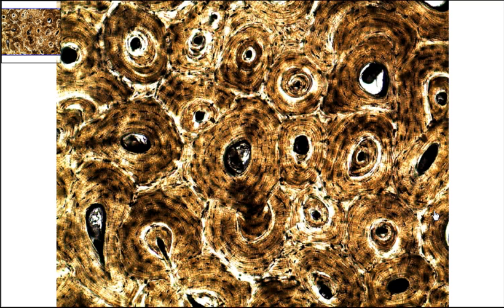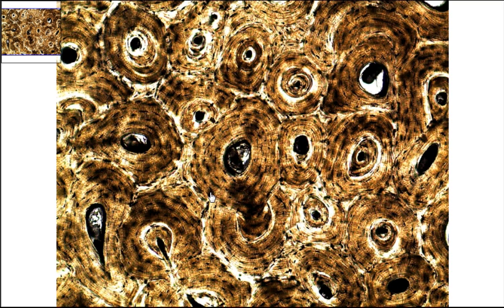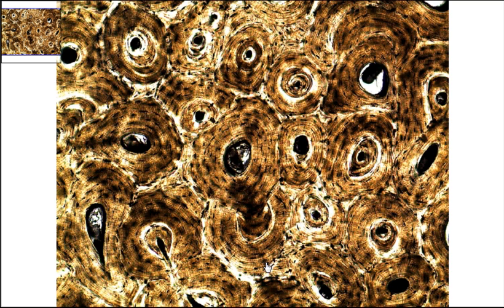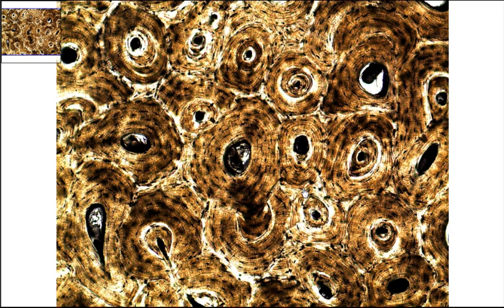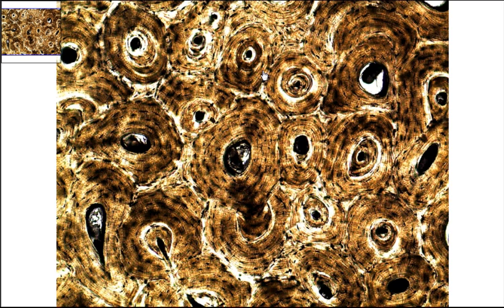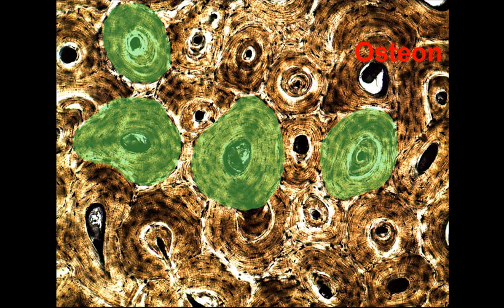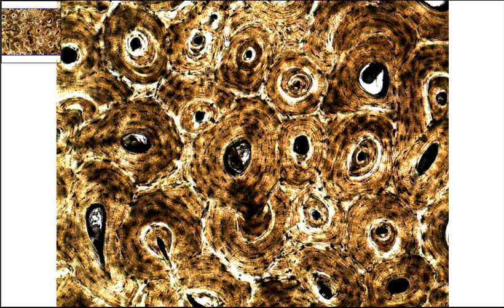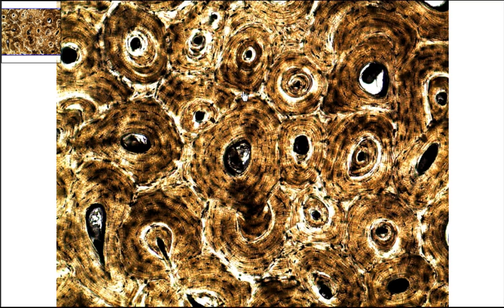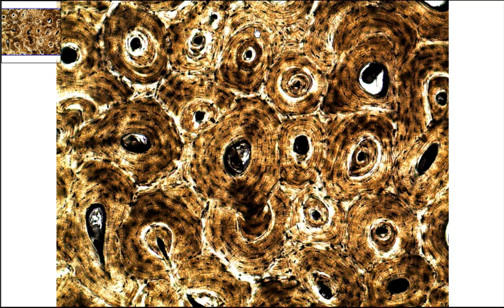One thing that should really jump out are all of these patterns of circles. These circular patterns — each one is referred to as an osteon. An osteon is the structural unit of osseous tissue, or hard bone.